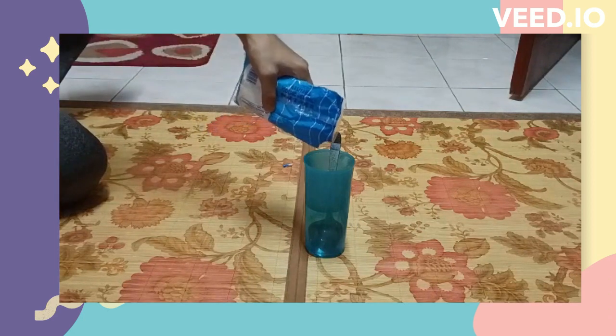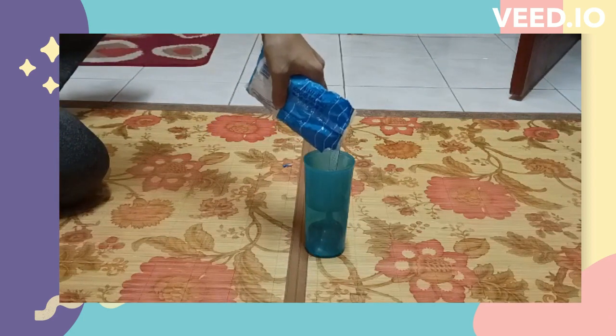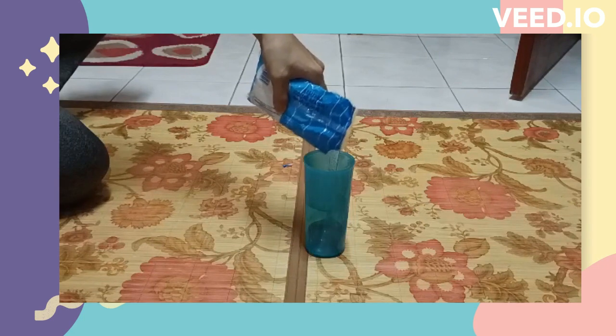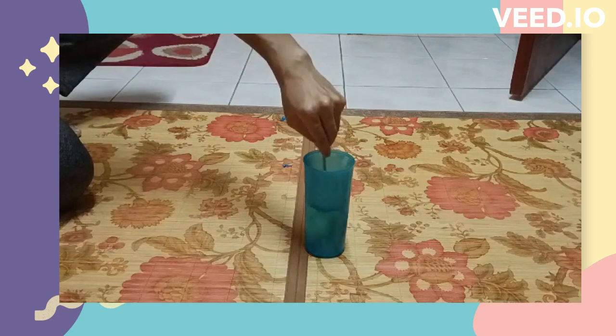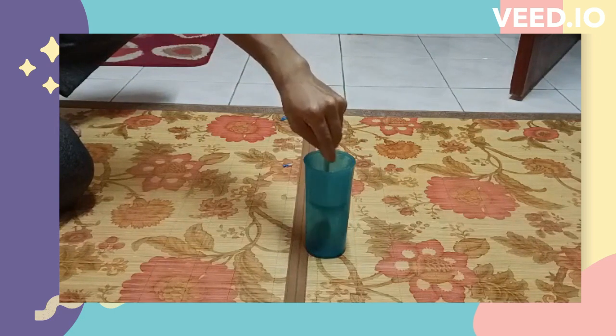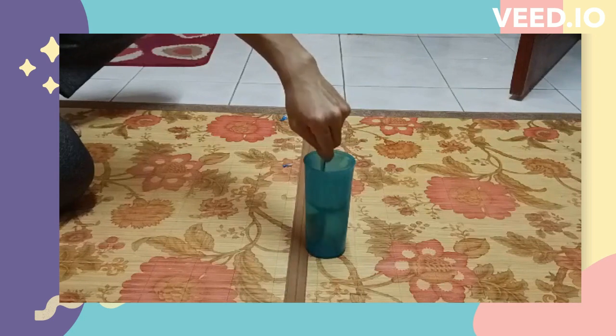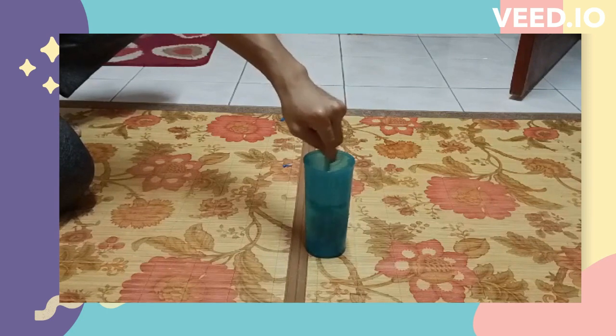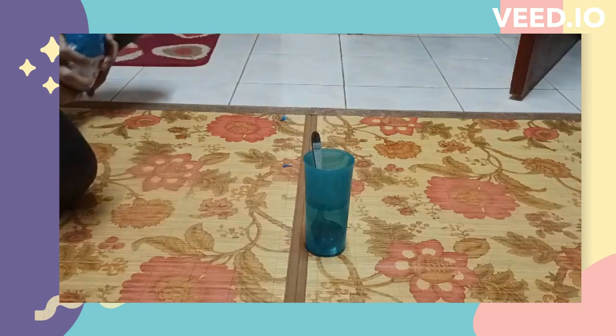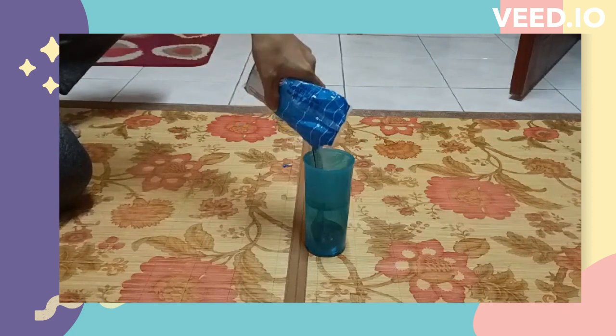So first of all, put the salt into the water. Keep adding the salt until it cannot dissolve anymore.